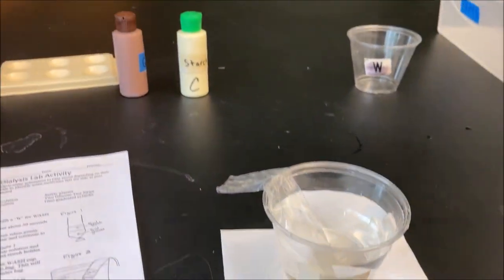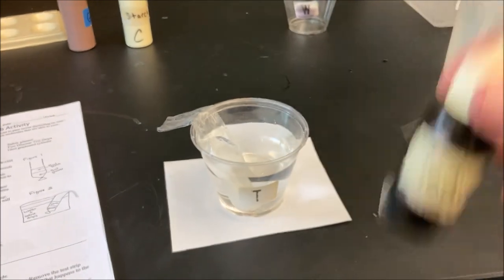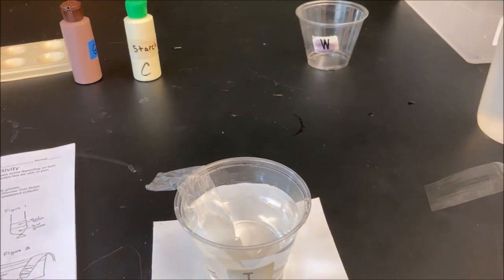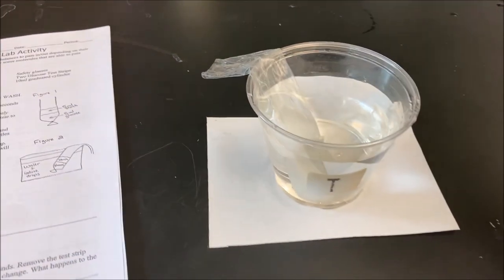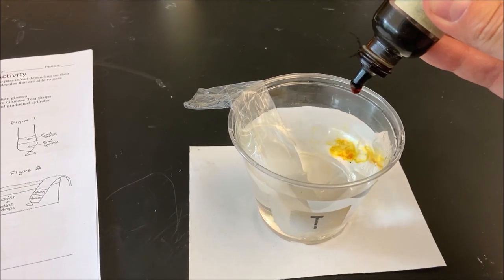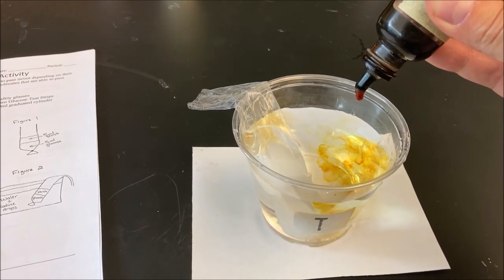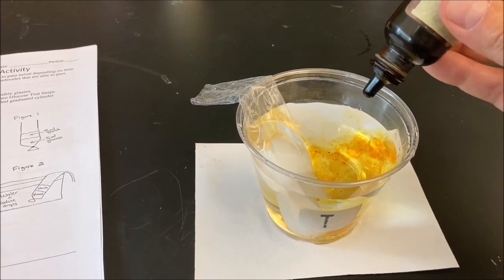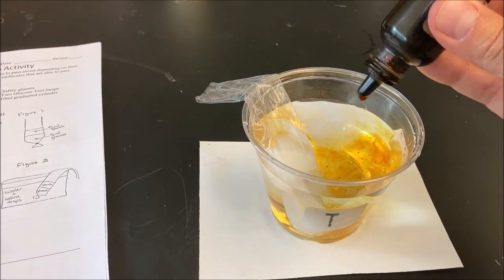Now I'm going to add some drops of iodine. Iodine has kind of an orange bronze color to it. I'm going to add about 30 drops of iodine into this testing cup. It doesn't have to be an exact 30 drops — it's okay.